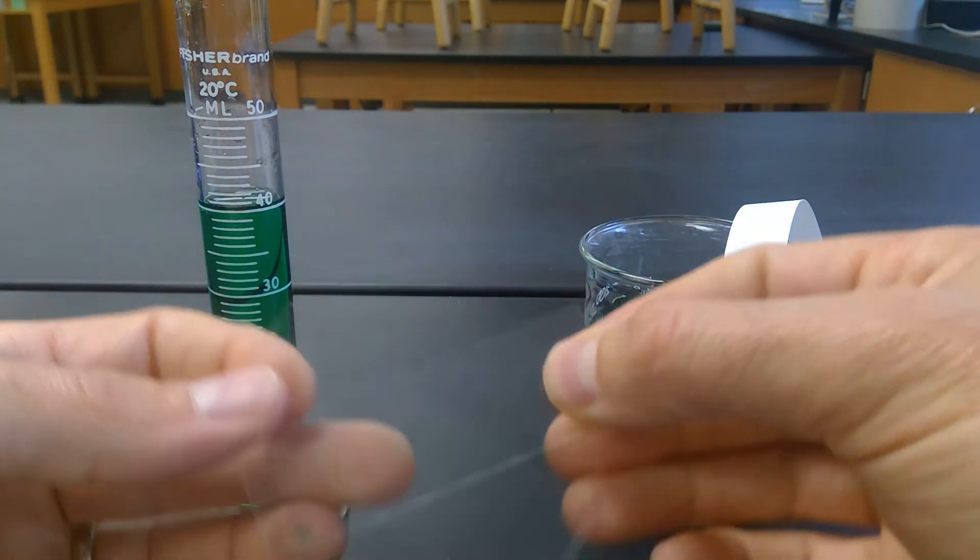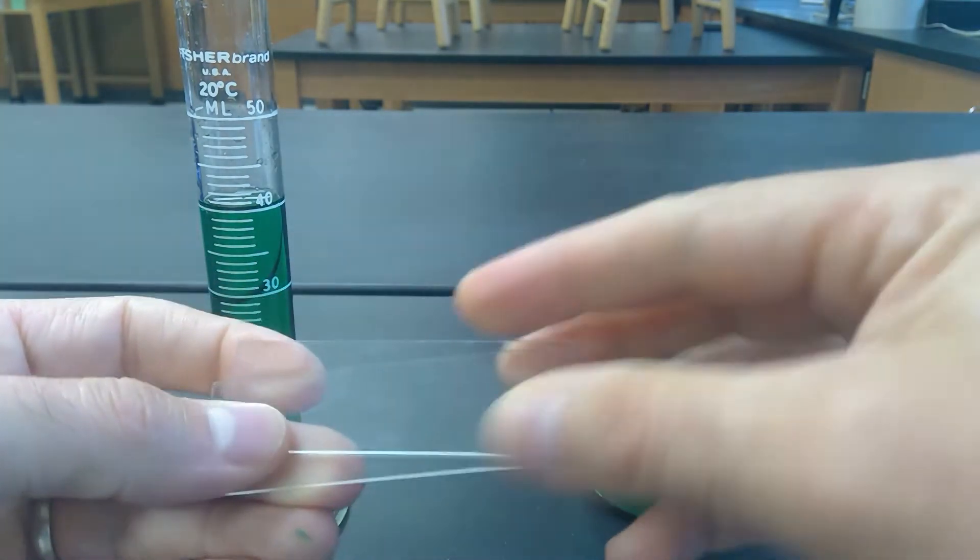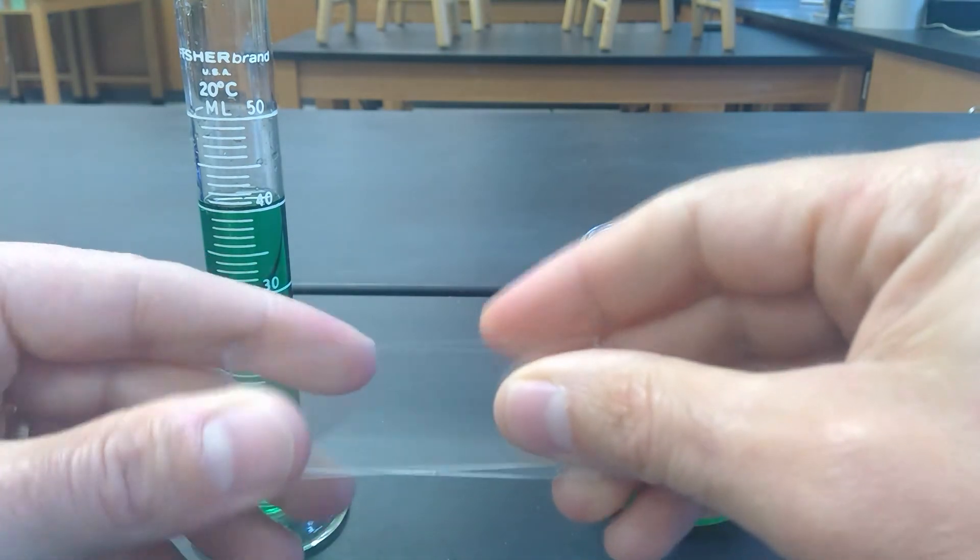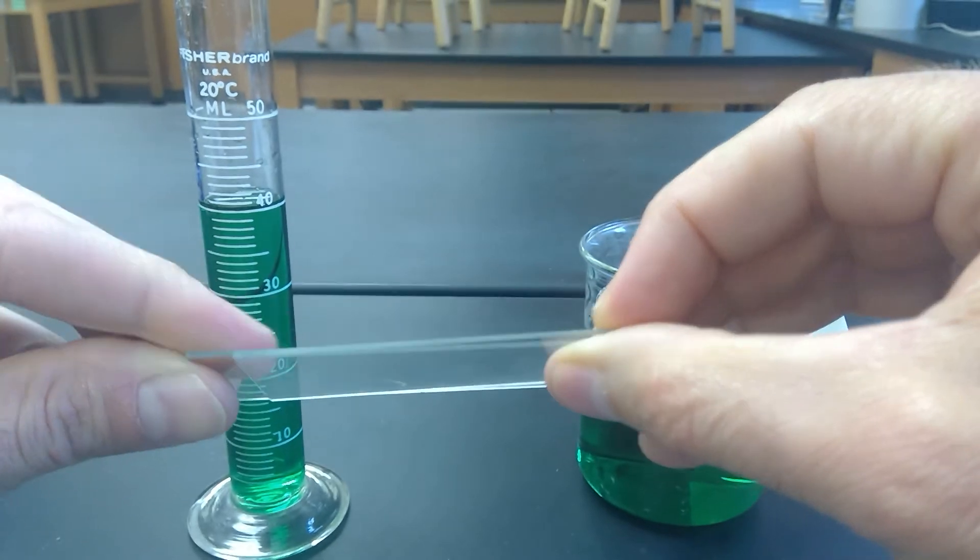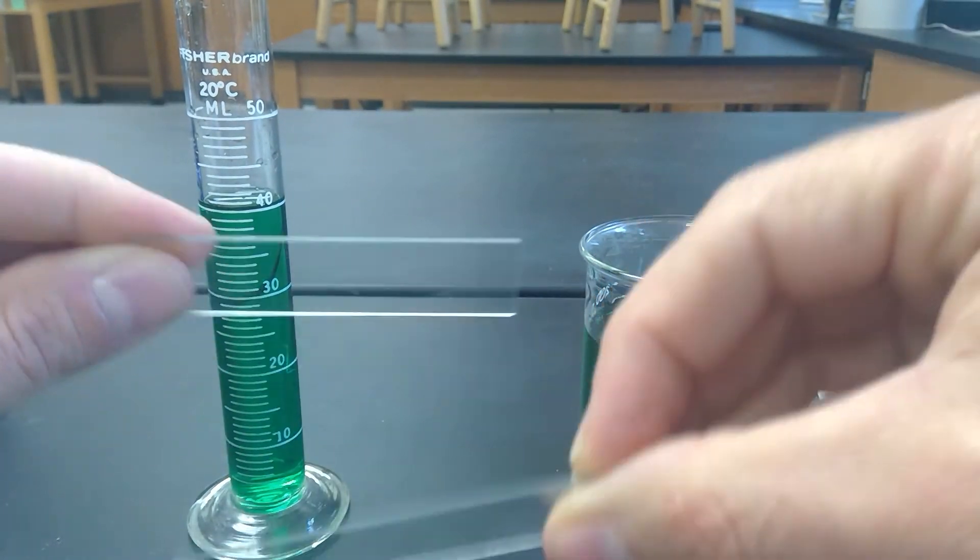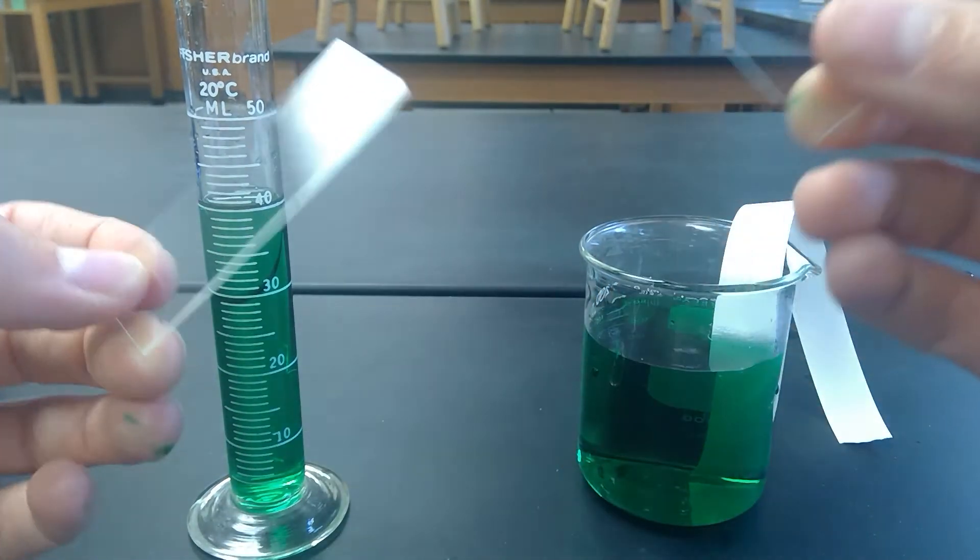I don't want to make them drop onto the lab table so that they would break, but ultimately they're not sticking together. There's a little bit of static between them, a little bit of pull there, but otherwise not really sticking very well.